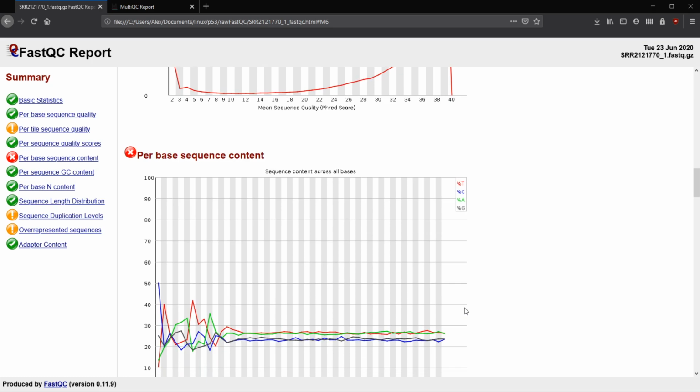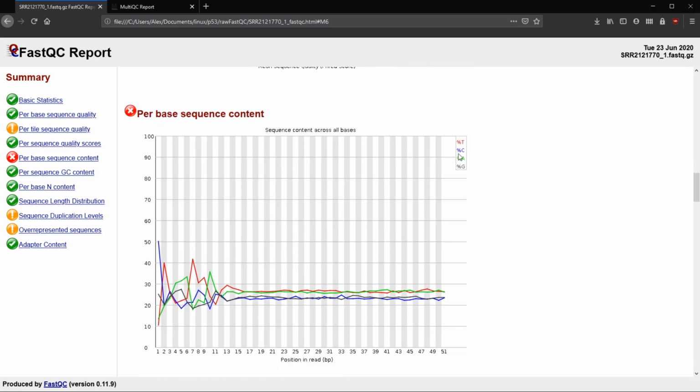Next, we have per base sequence content. So this shows the percent of each base that is an A, T, C, or a G. Generally we want A and T to have the same proportion or the same percentage, and we want C and G to have roughly the same percentage. If there are any massive peaks or dips for one of them that isn't including this beginning part, that's probably an indication of an overrepresented sequence that is contaminating the library.